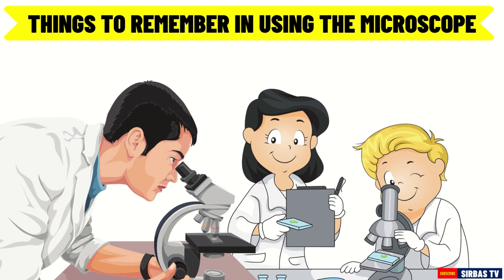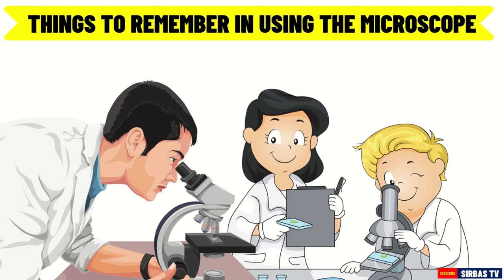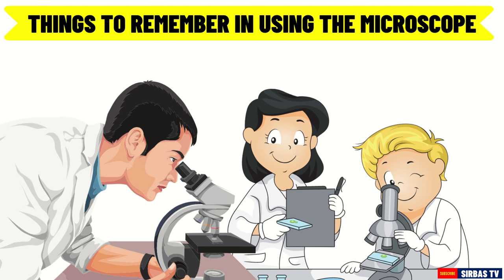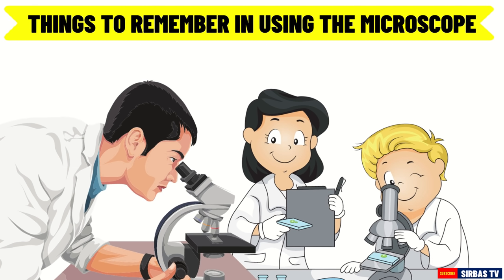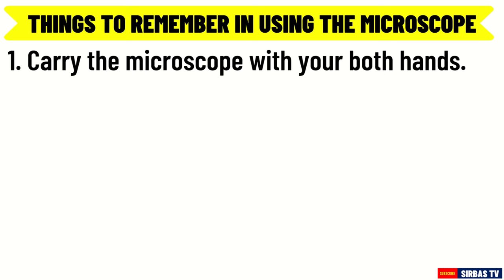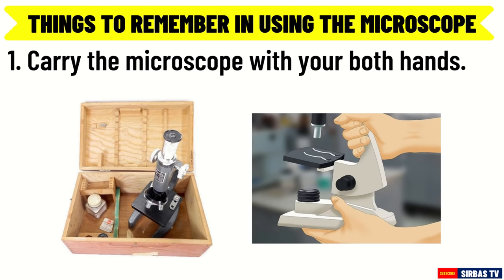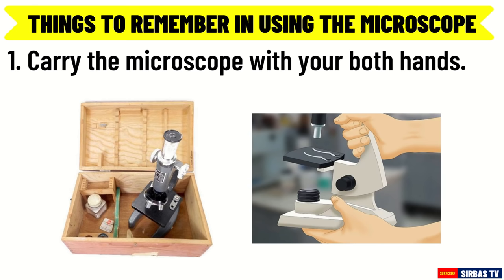These tips about the proper use and care of the microscope will also help you and your school maintain the equipment for efficient and longer use. Here are the things that you need to remember. Number 1: Get the microscope from its box or the cabinet. Always carry the microscope with both hands. Hold the arm with one hand and place the other hand under the base for support.